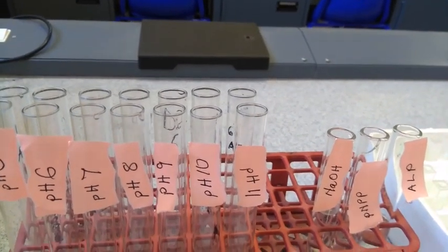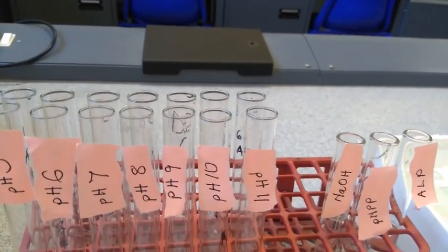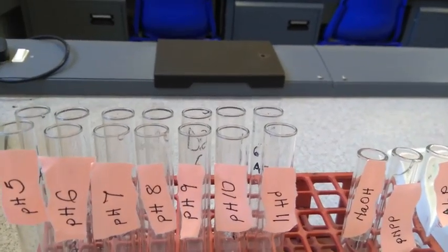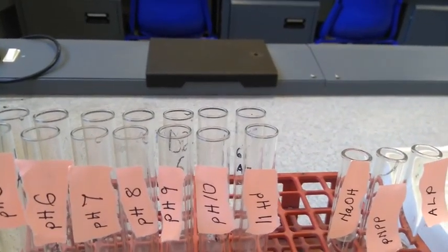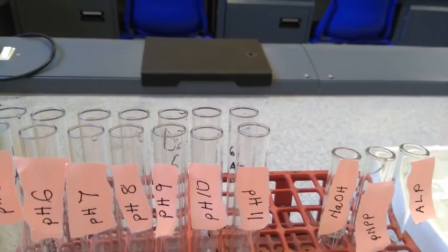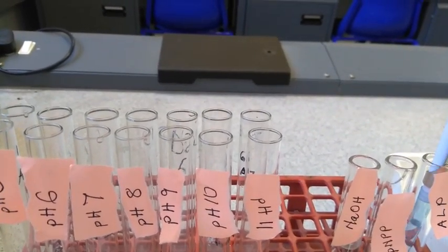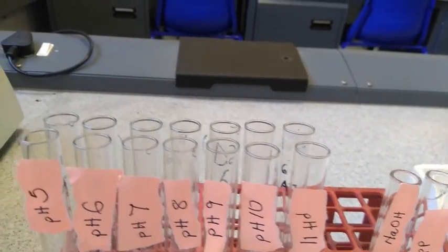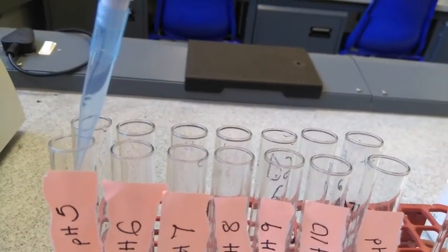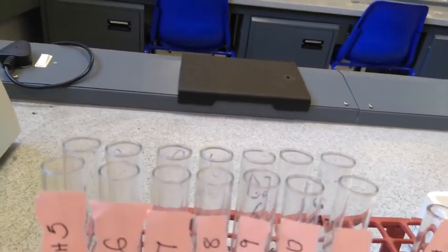We will now add the enzyme at prescribed intervals. Remember, if we start at 2 o'clock, then at one minute past 2 we add the next one, so that they all have the same incubation time. So at 2 o'clock we add the enzyme at pH 5 and we wait for a minute before adding to the next tube.